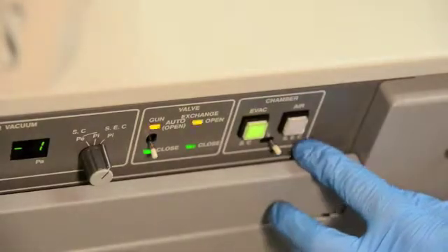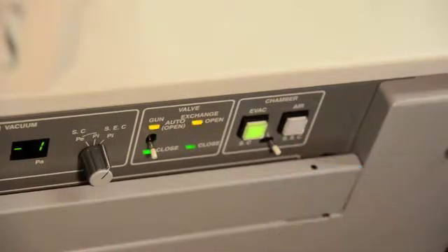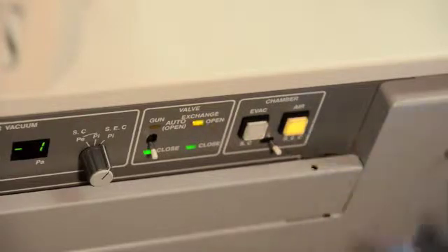Check to make sure the vacuum switch is set to SEC for specimen exchange chamber. Press air, the button will turn yellow. You will hear air filling the specimen exchange chamber.